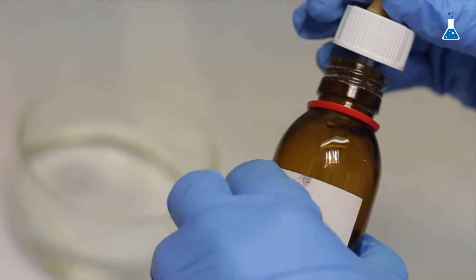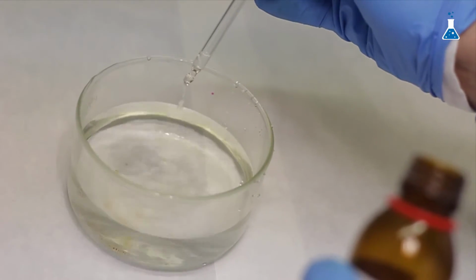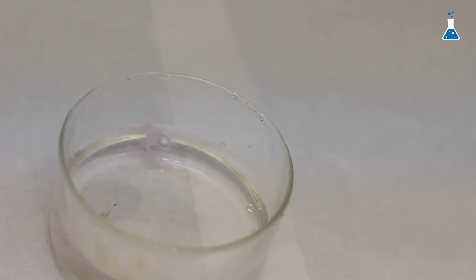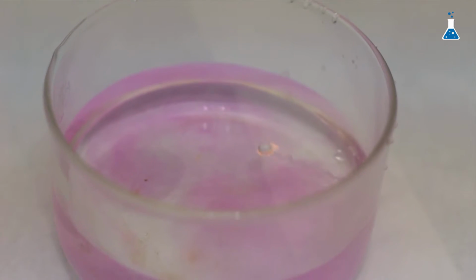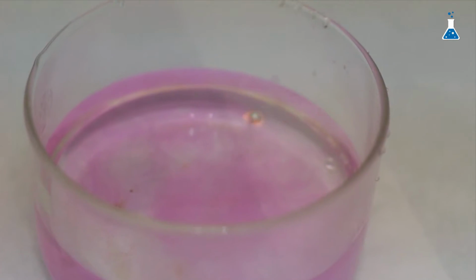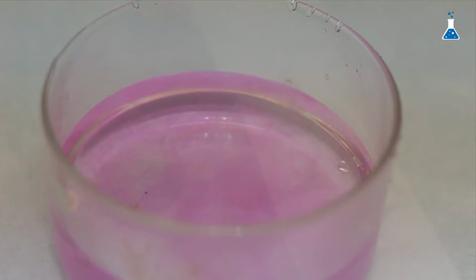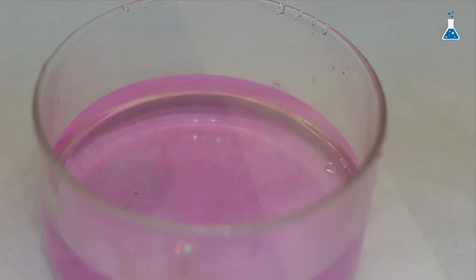Let's drop it in the crystallizer with water, but this time with phenolphthalein in the crystallizer beforehand. We will see how the reaction proceeds much faster and the solution turns pink quickly. As you can see, a flame comes out from the molten metal that is moving, floating around in water, not only because it's less dense than water, but also by the effect of the hydrogen that is being produced.